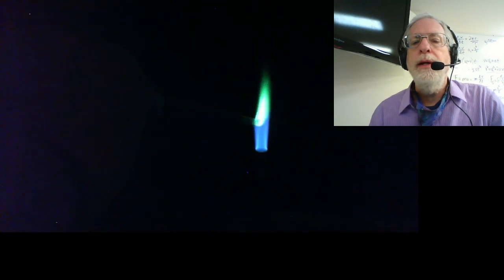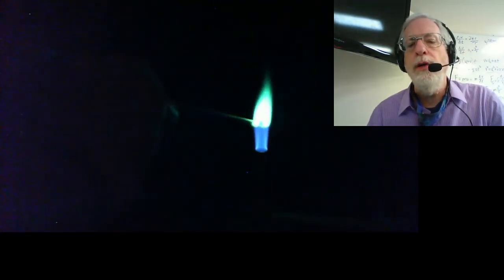And that'll be our last flame test, copper 2 chloride. Here we'll look at. And I get a really good reaction again. Kind of see that color going through. Rewind it, play that again. So this is our copper 2 chloride. Pause this video as you need to explore and tell me what those colors are.